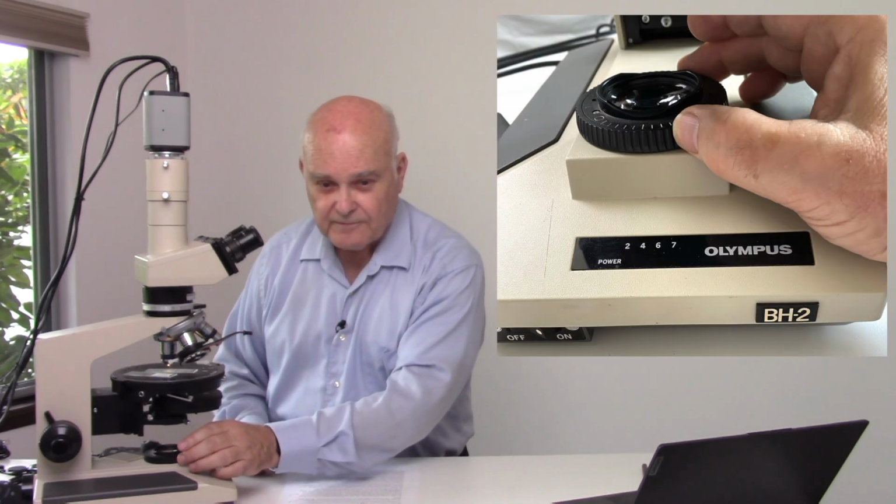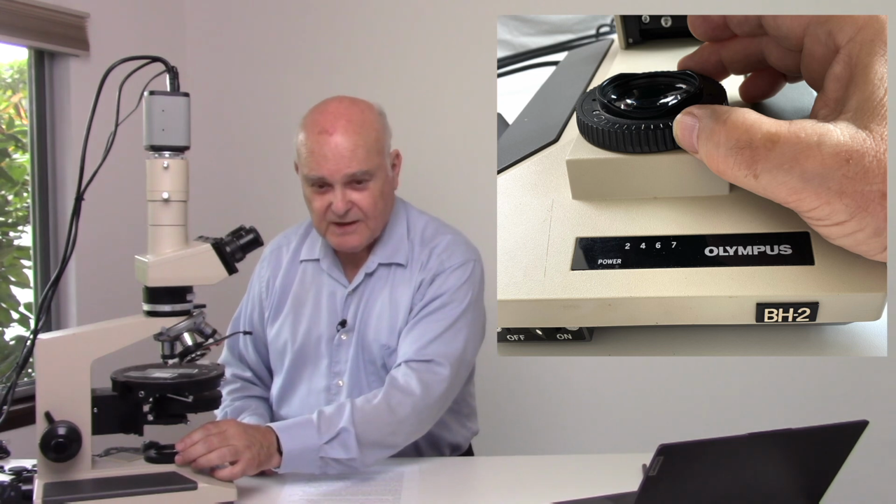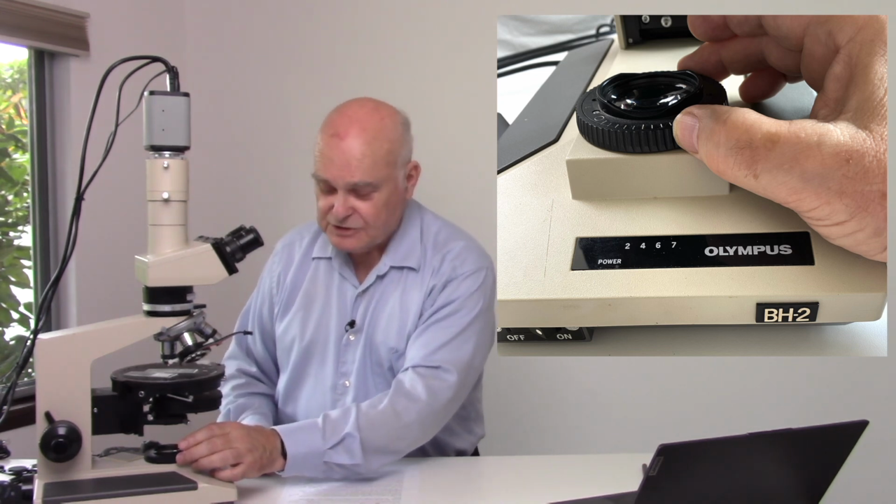Now, in order to do that, we're going to use focal plane 2, which is the field iris. That, as you recall, is adjusted here with this little ring. Notice that as we change that, that also affects the image of the particles. Now, we want to adjust this system so that when we change this iris, the only thing that changes is whether or not the leaves of the field iris move into our field of view. We don't appreciably change the appearance of the particles. That's an important aspect of this design.